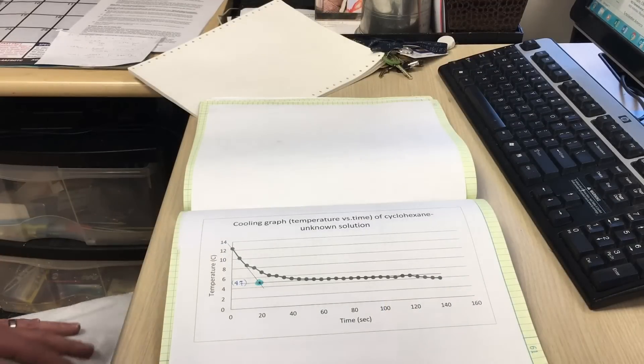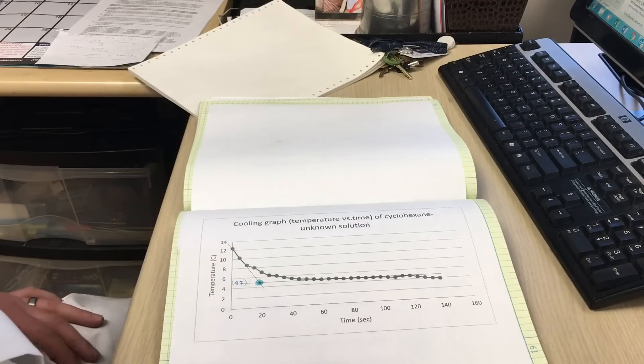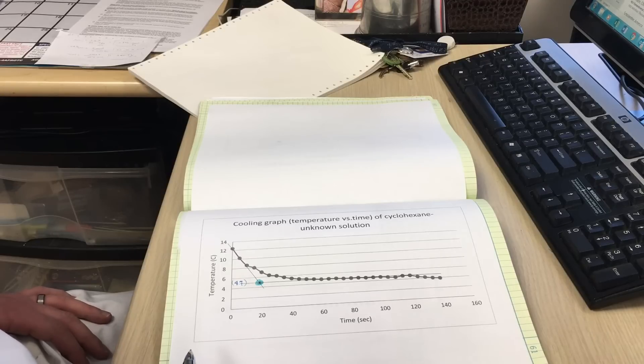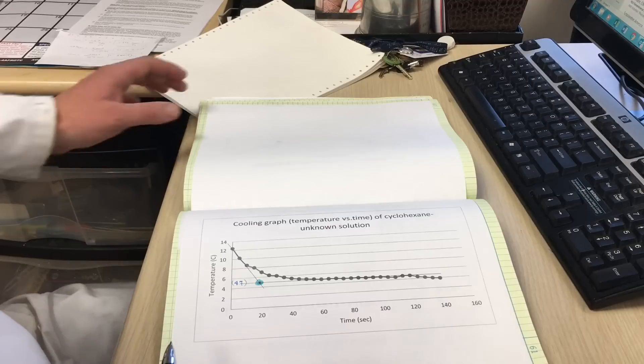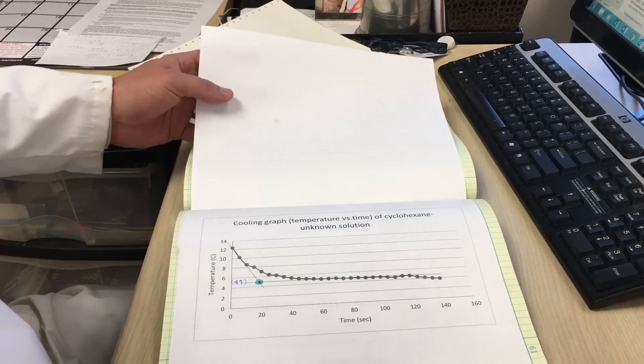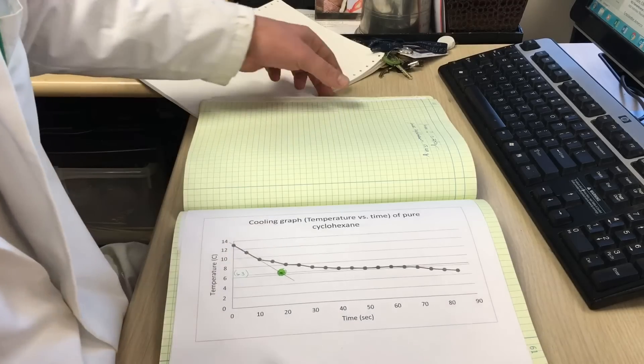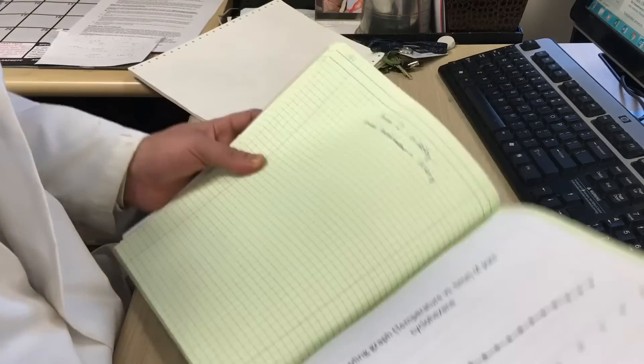We graphed the data for the cooling curve of the solution and we found a freezing point of 4.7. Now we have all of the information we need to do the calculations for this lab.